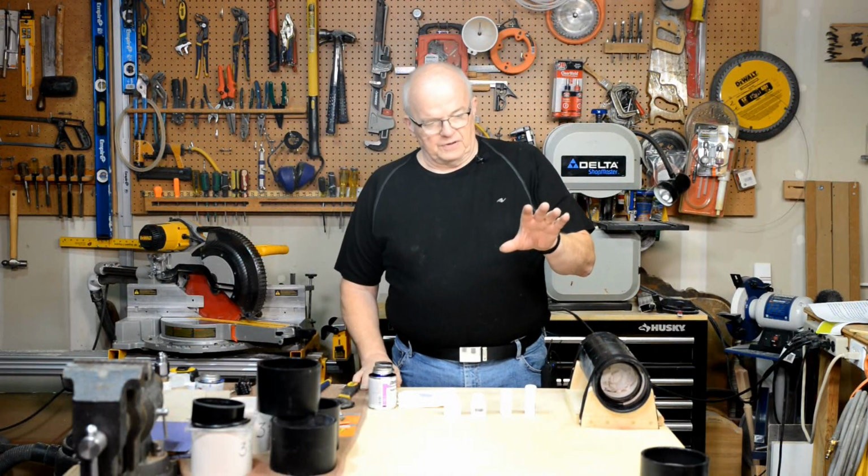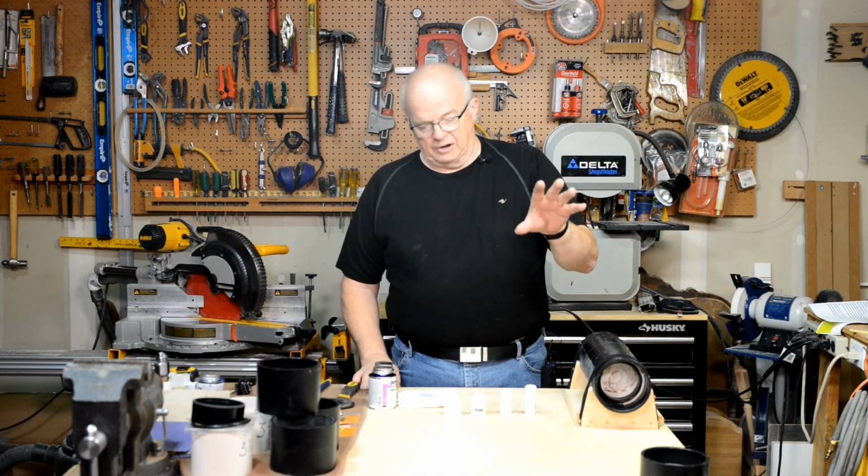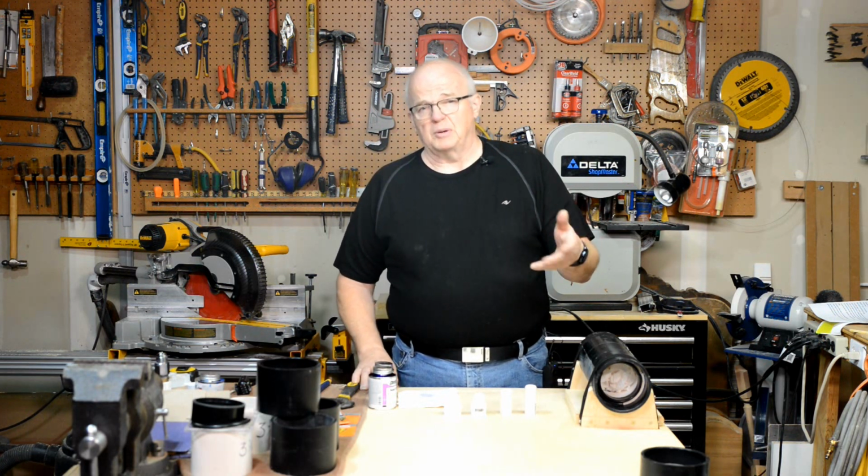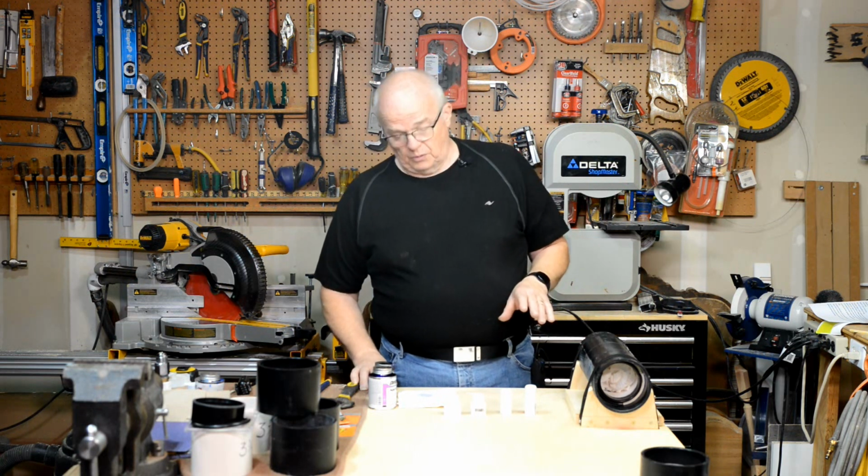Okay, now that you've got that end cap completed and it's off, it should begin to set up in about 10 minutes, maybe to a half an hour. It'll be at least that long before we get back to it.